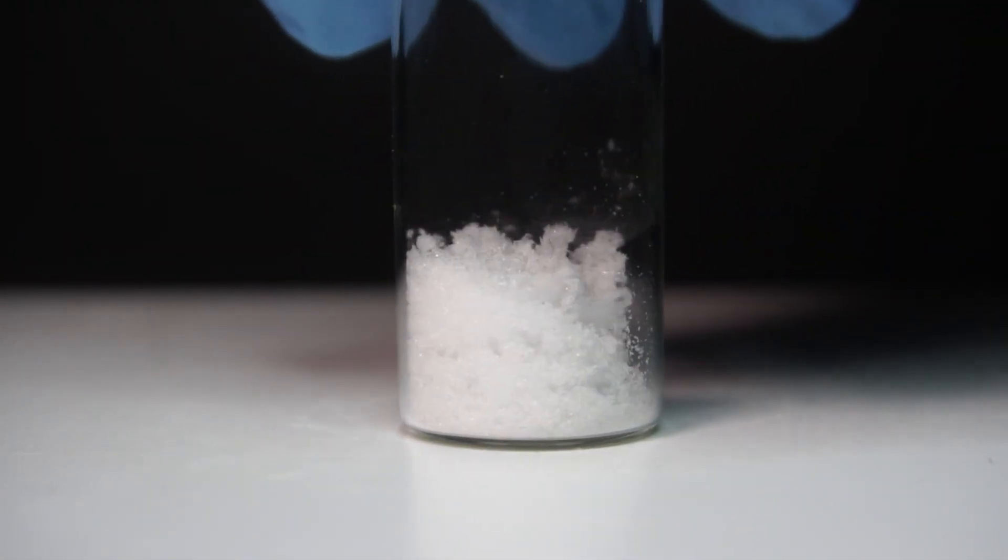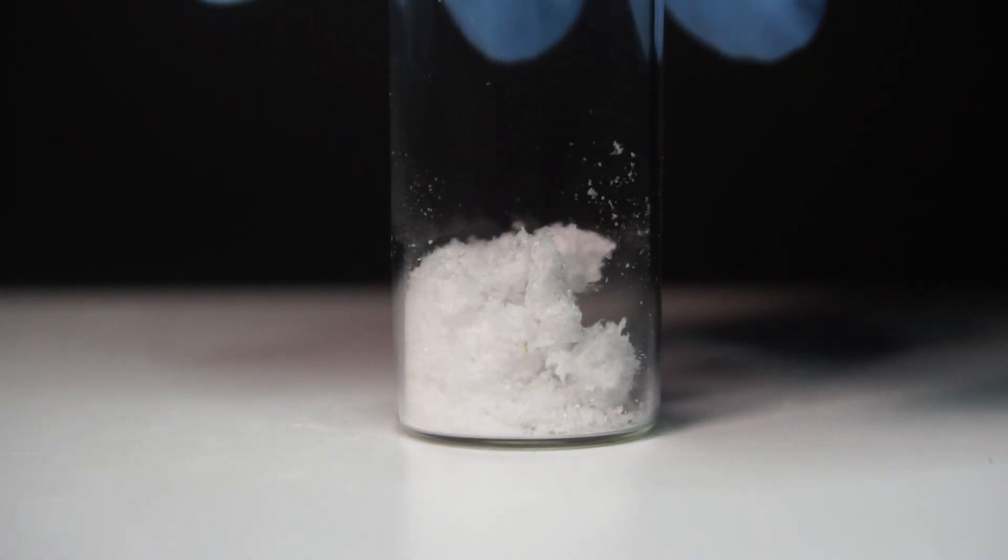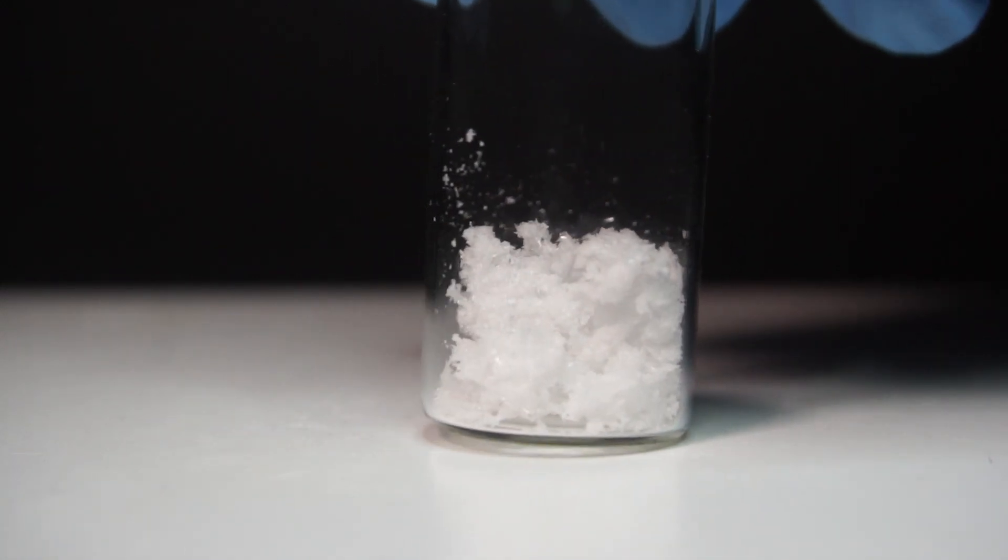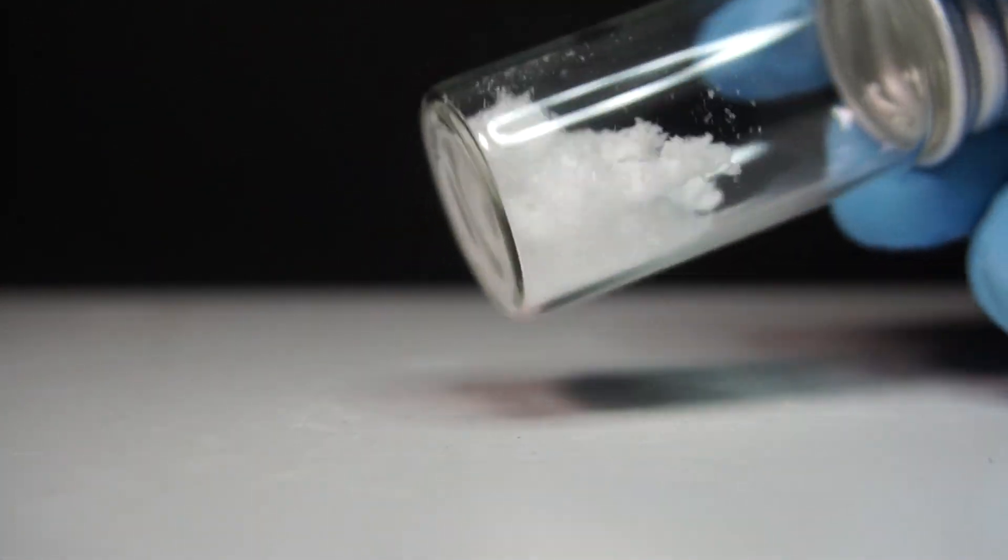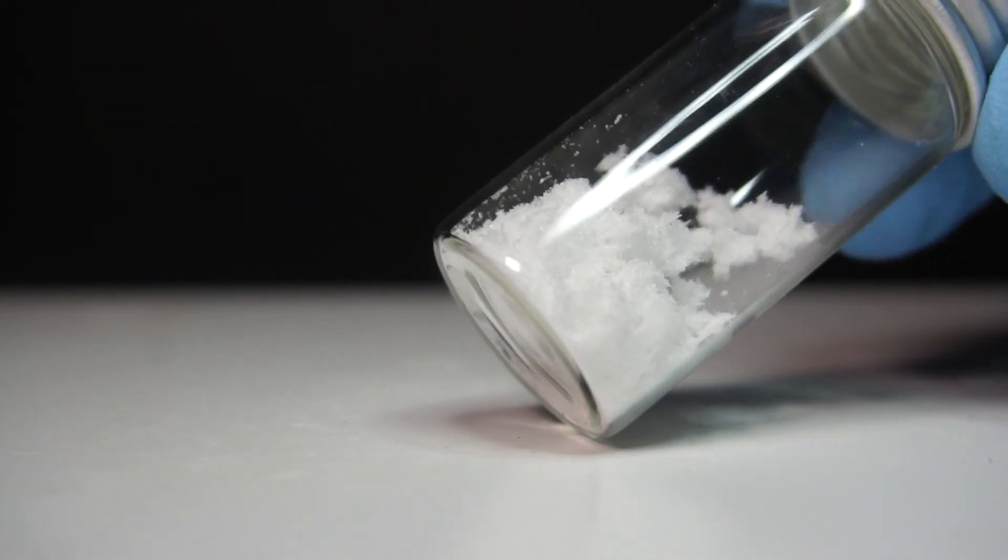Ammonium chloride is used in all sorts of things from fertilizers to cough medicine and even glue as a binder in plywood, though I'm making it to make some storm glasses in the future. So, let's get started.